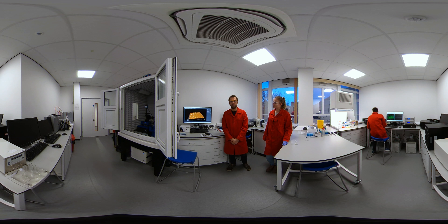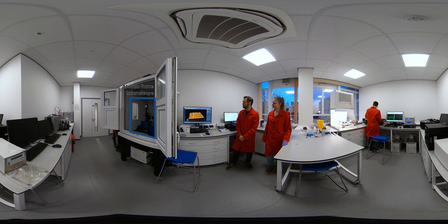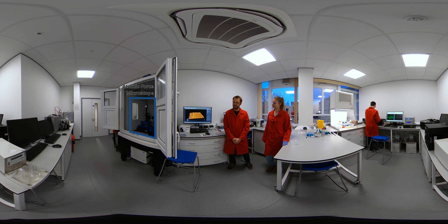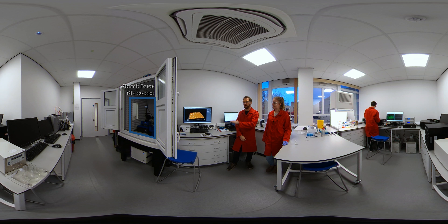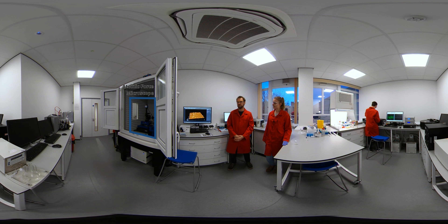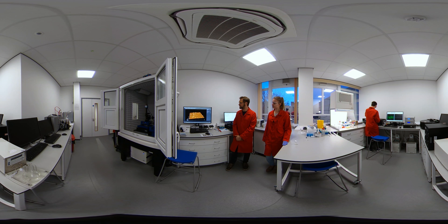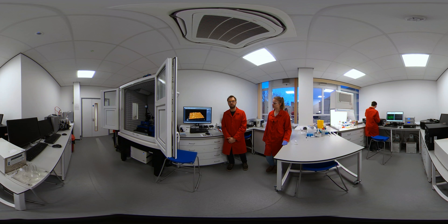Next to us we have our atomic force microscope, or AFM. We have our particles on a surface in the microscope, and this machine will simply analyze the height profile of that surface to show us the particles that we've made on top. We can view the size, shape, and properties of those particles using this instrument.